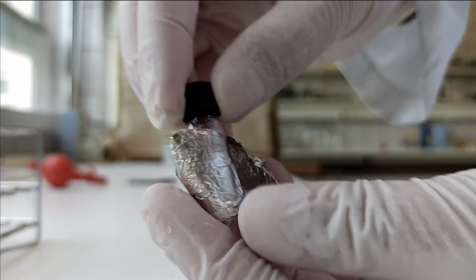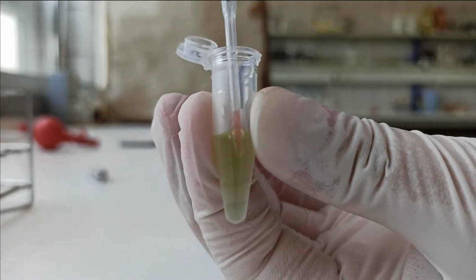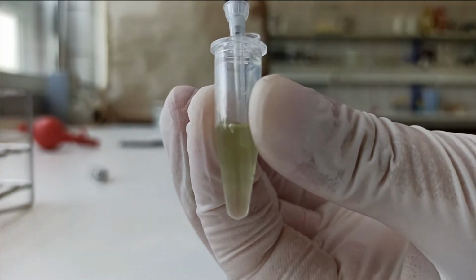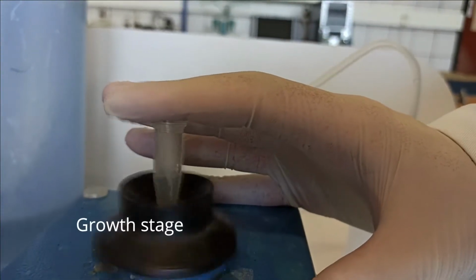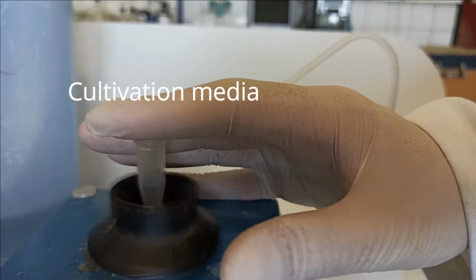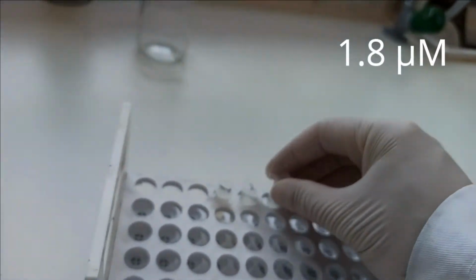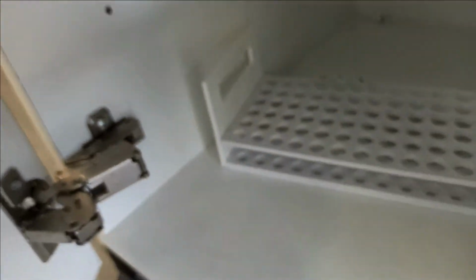Now pick your working stock solution of Sytox green and stain your PBS diluted samples. You should always optimize the concentration of Sytox because it varies depending on the cell concentration, species, growth stage or cultivation media. In this method, we used Sytox at 1.8 micromolar and incubated samples for 25 minutes in the dark, since Sytox can suffer photodegradation.